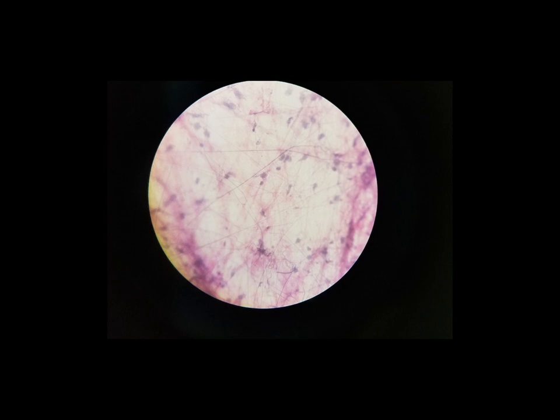There are cells that are scattered, and we see the nuclei of the cells, and there's not too many of them. Most of what we see is extracellular matrix, and then we also see fibers. And that's going to be how we can determine which connective tissue it is we're looking at.